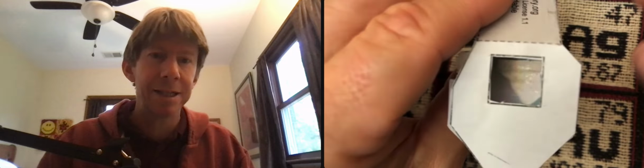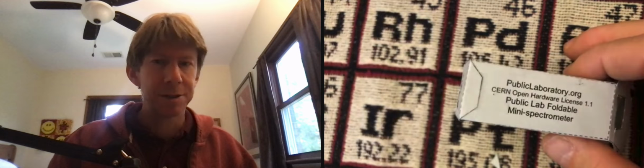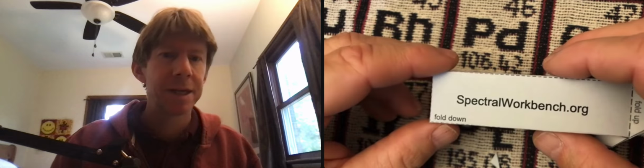There, you can see a rainbow. And the rainbow goes north-south. So the rainbow is going this way. That's because we made it so that the rainbow, when we put this piece of plastic in here, goes this way. If your rainbow goes side to side, you do need to take it out and rearrange your piece of plastic for it to work. And that is how you construct your Sacramento City College spectralworkbench.org spectrometer.